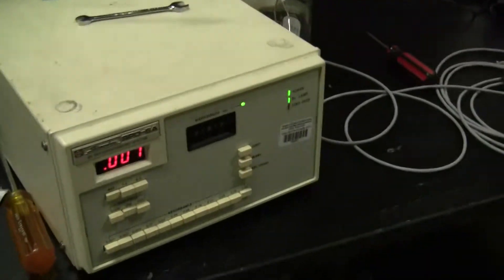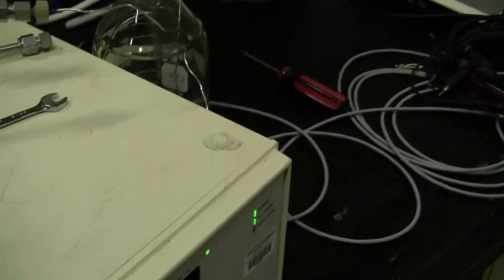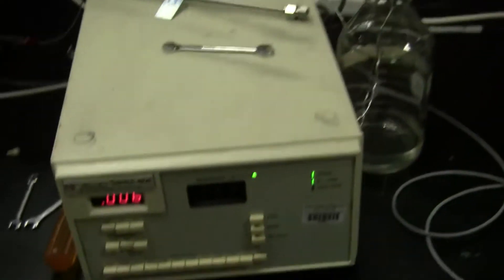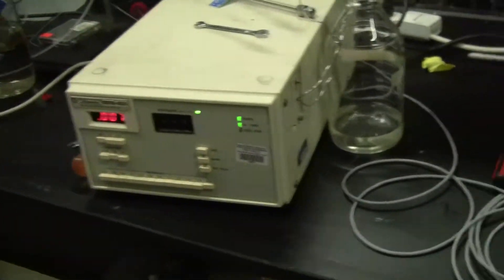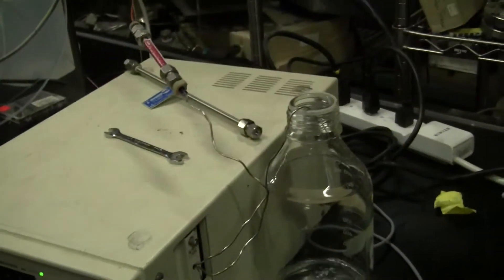So I will inject my sample using a Rheodyne valve. I'm going to start the run.